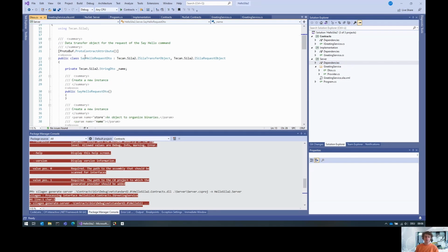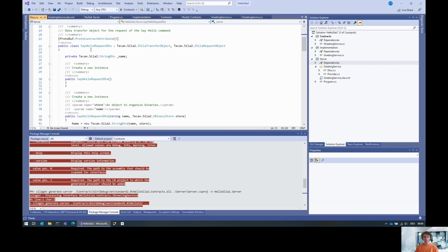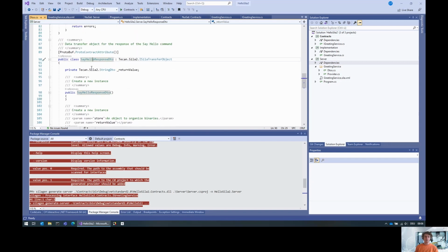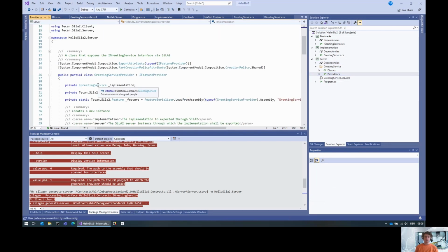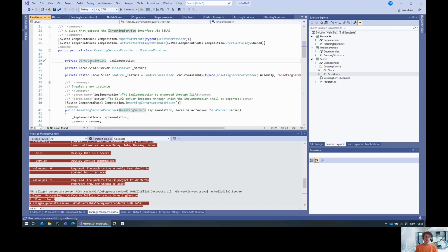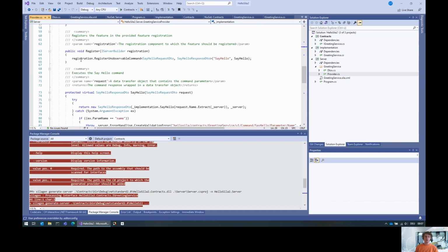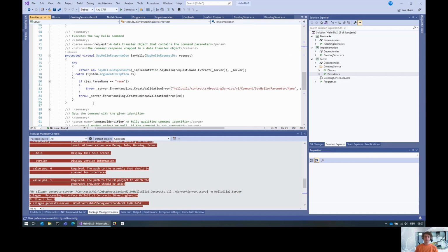And here we basically have data transfer objects to describe how the request object of a say hello command is going to be serialized and how the response is going to be serialized. And then there is this so-called feature provider, which specifies, given an implementation of the IGreetingService, how do you actually expose that to SiLA 2? So there is going to be an unobservable command with those parameters here, and if you execute this command, you actually execute the inner command and do some error handling in case there was something wrong.